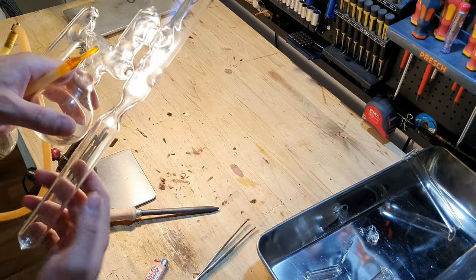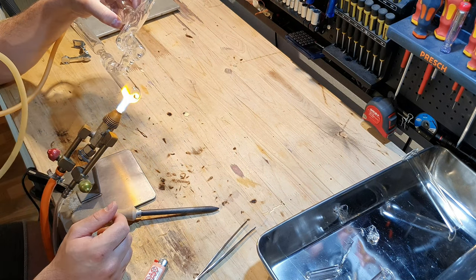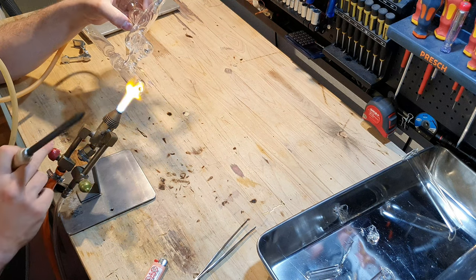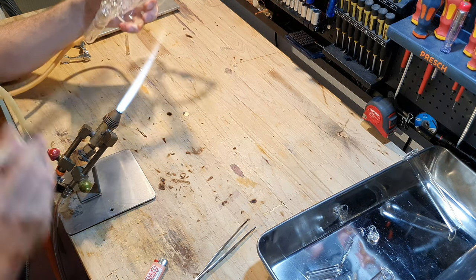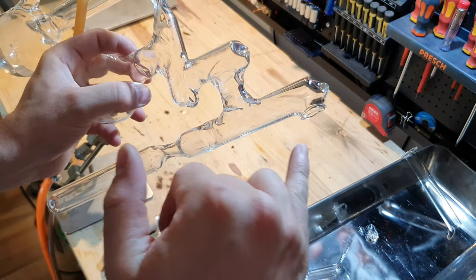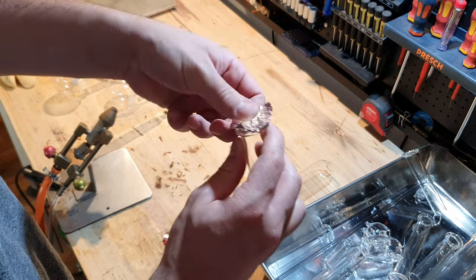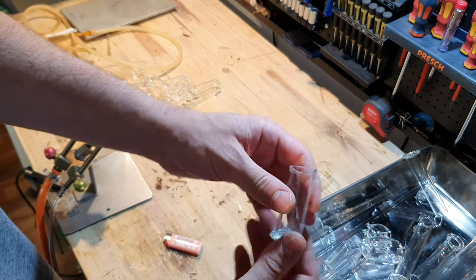Now I'm going to blow a hole in right here to connect my KF flange. I now have a hole right here that I can use to connect my KF flange. I now want to connect my KF flange to my still right there. To be able to blow inside the still I have to close off the KF flange so the air can't escape. It will be pretty uncomfortable to hold it because it's getting quite hot, but the piece has to be this short.